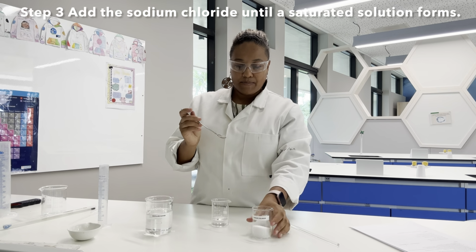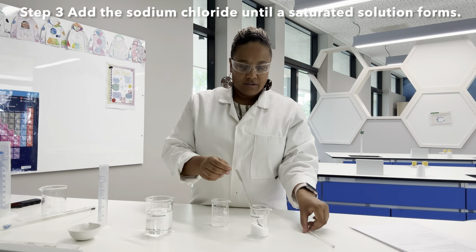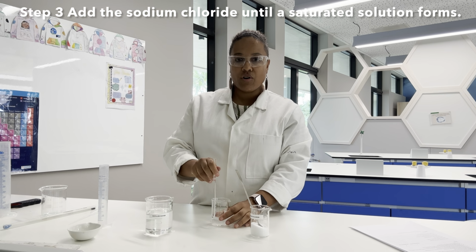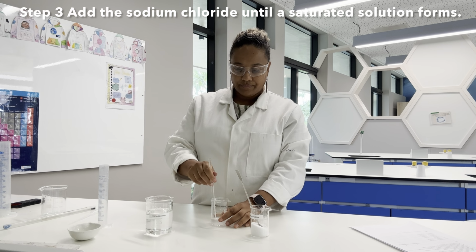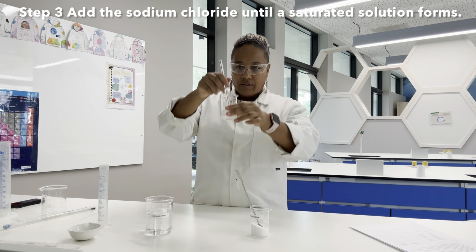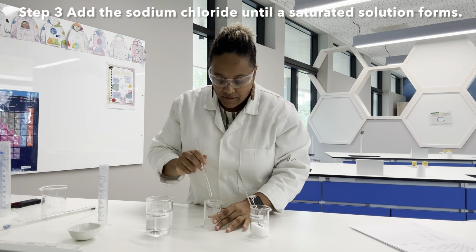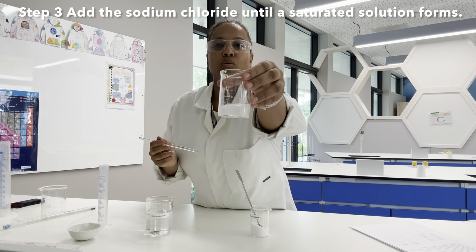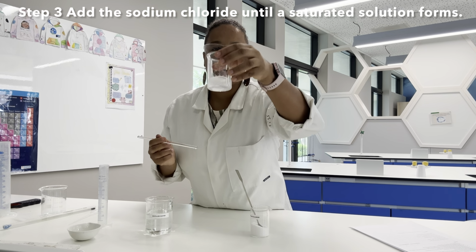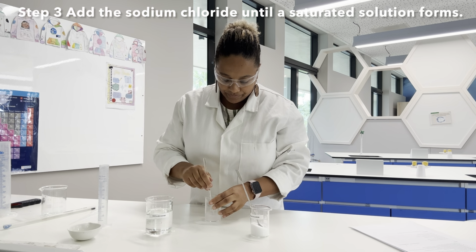So, taking my spatula, I'm going to keep adding sodium chloride, stirring with this glass rod until no more will dissolve. So just stirring, and we're just doing this at room temperature, so I can see that it has all dissolved. It does look a little bit cloudy, but I think that's just the camera angle.